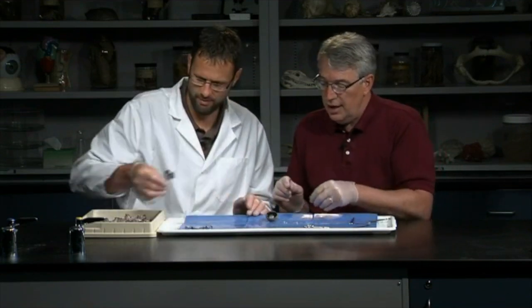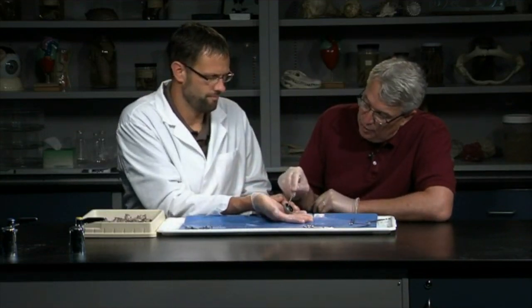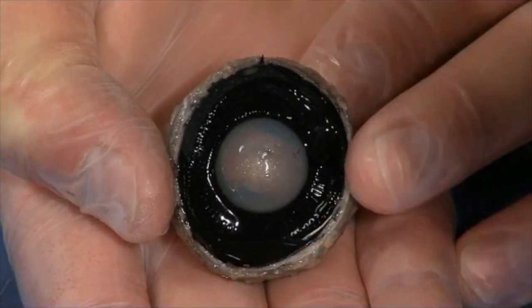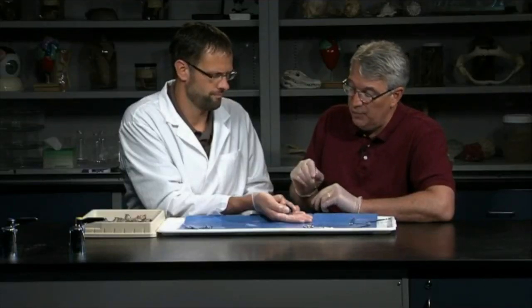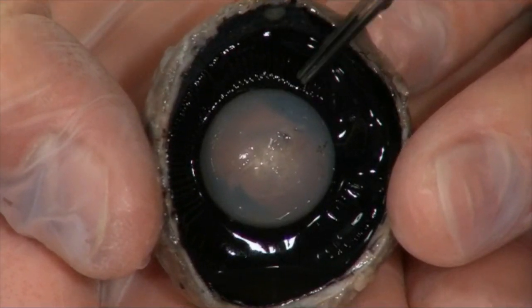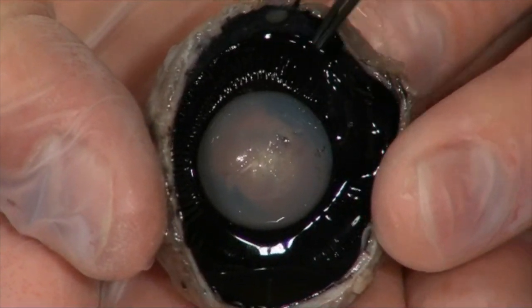Okay. Should we move to the front? If we go to the front part of the eye, here we go. Steve has it here. And of course, right away you notice this big spherical thing sitting there in the middle, that's the lens. And so the lens focuses the light on the retina. And you can see in here it looks like it's almost plastic. It is kind of, at this point, layers of membranes, but it is a living tissue. And it's situated right in that opening, and it's attached to these ciliary processes, or this ciliary body, these striations here. And so it's those muscles in the ciliary process that can change the shape of the lens.